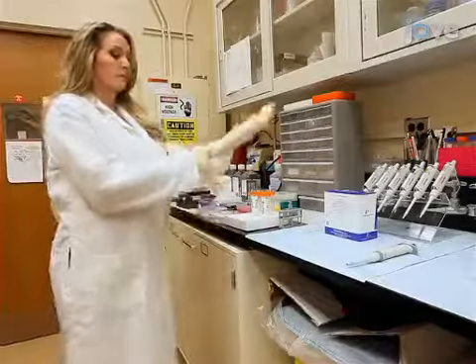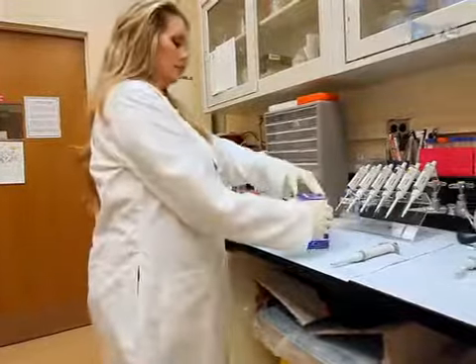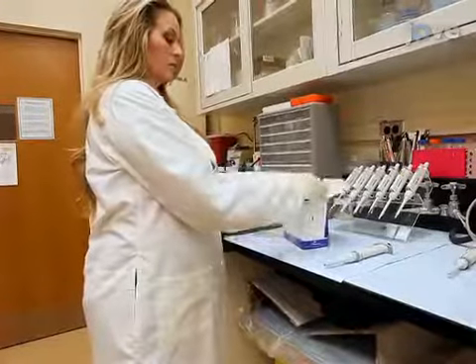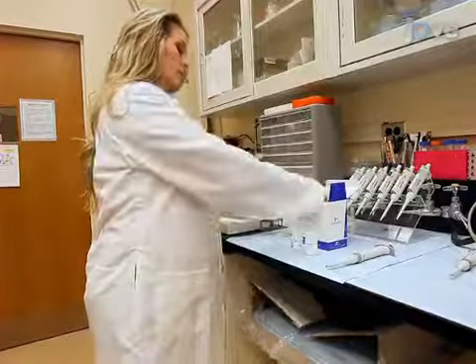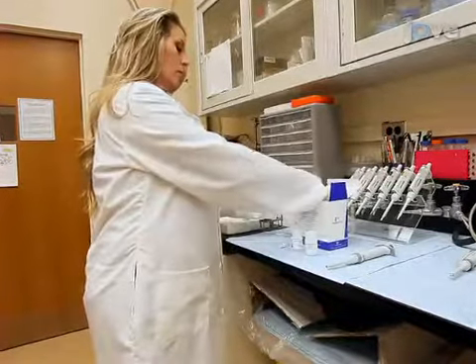Although the tyramide signal amplification, or TSA, step occurs in the final stage of labeling, preparing for this reaction can take more than an hour. It is therefore more convenient to make the TSA reagents first.